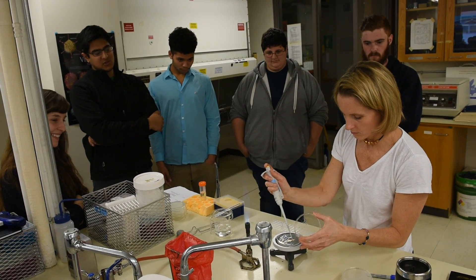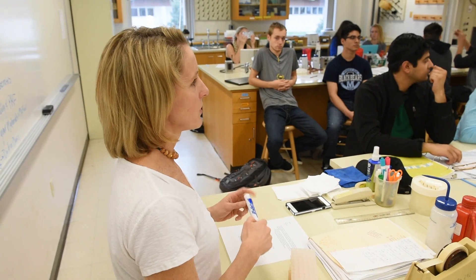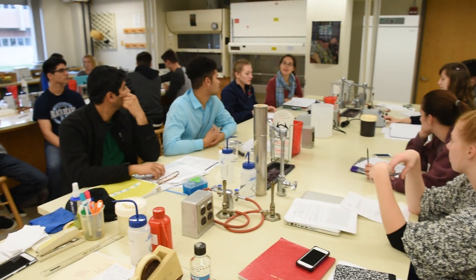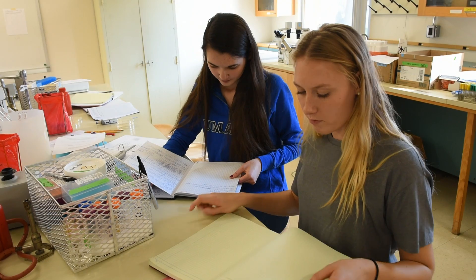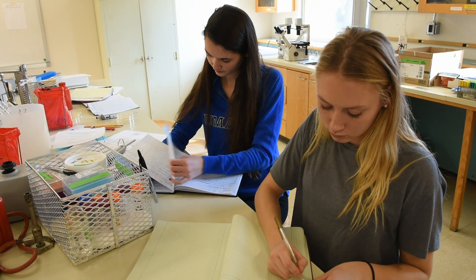This is our course, Phage Genomics. We're in our fifth year of teaching this course where the curriculum is from the Howard Hughes Medical Institute. In September when we got here we collected soil samples and then we went through the process of enrichment, which resulted in a phage which we worked on for the rest of the semester.